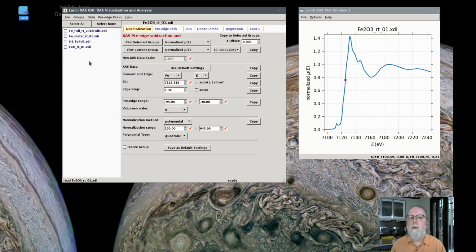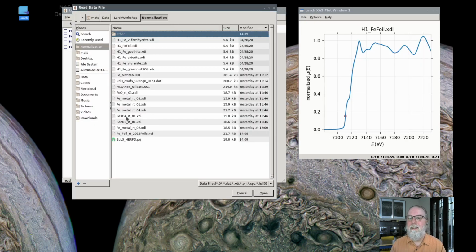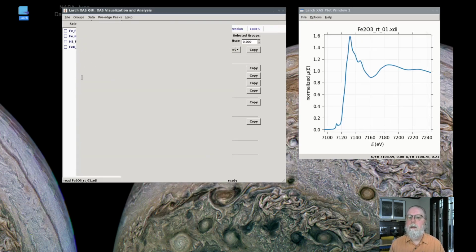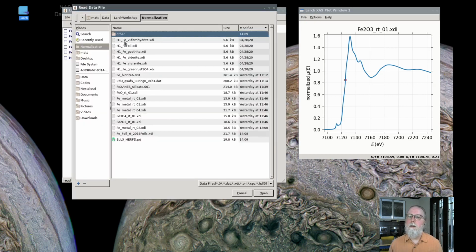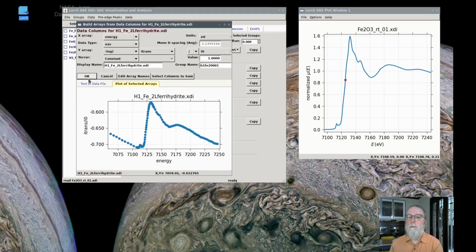So I'll move this one to the bottom of the list, and then I'll read in that one again. The Fe2O3 and the Fe3O4 data. These all went together, were all measured at the same time. If I take this one and move it to the bottom, then I'll read in some of these other data that are labeled as H1 that were all measured at the same time on a different beamline.